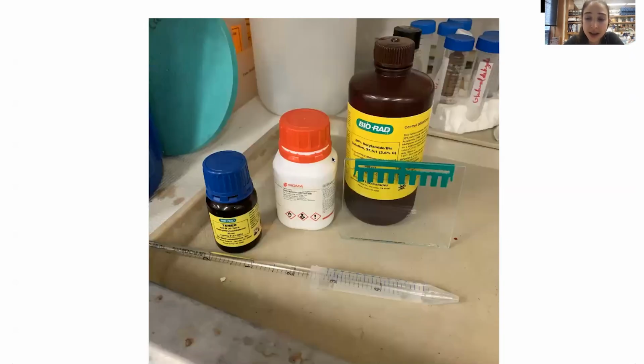So the key players that we have are this acrylamide bis solution, ammonium persulfate, and TEMED, N,N,N',N'-tetramethylethylenediamine. Yeah, I usually call it TEMED, but I don't know how people normally pronounce it. And then you have these gel plates, and your combs and the casters and stuff. And so the basic idea is to take this solution and get it to polymerize.